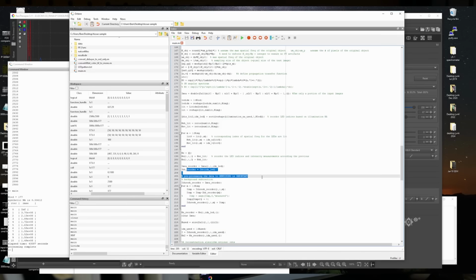I noticed a couple of notes from the original author of this code that said denoising is important, and so I experimented with different settings in RawTherapee to denoise the image, either not at all or actually to a very high extent, and I didn't notice a huge amount of difference.